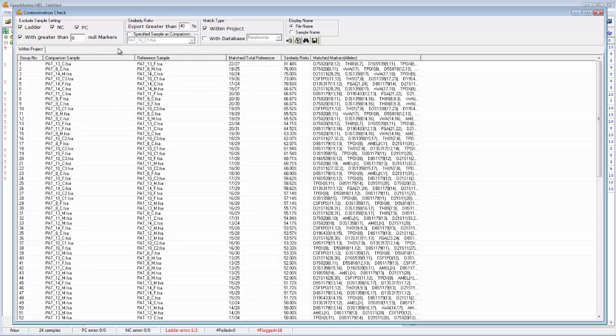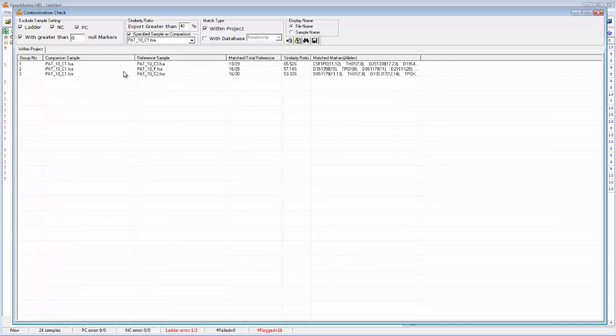Just to show another way of using this, let's use a specific sample this time, pat_10_C1. I'll refresh the results, and this time you can see my comparison sample is always pat_10_C1. And in this case, there were only 3 cases in which the similarity ratio was greater than 40%.